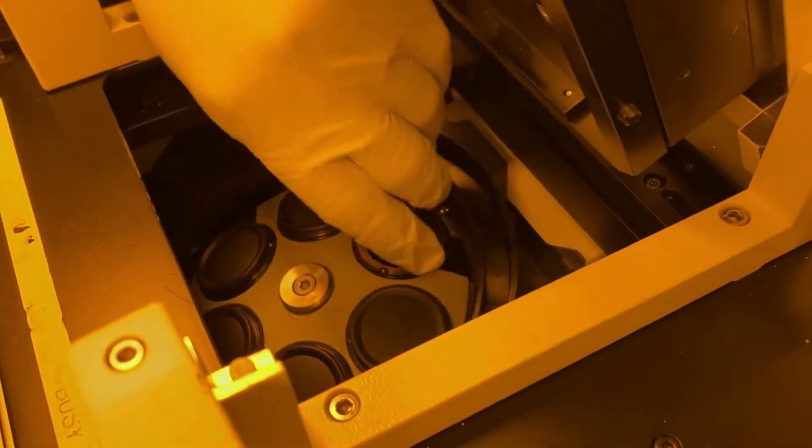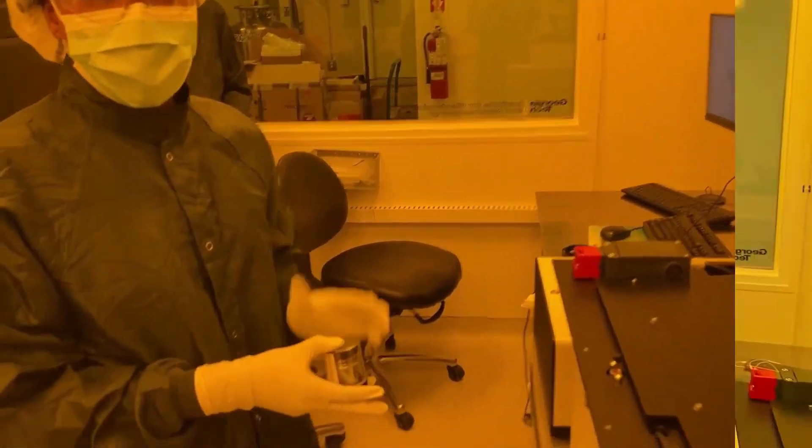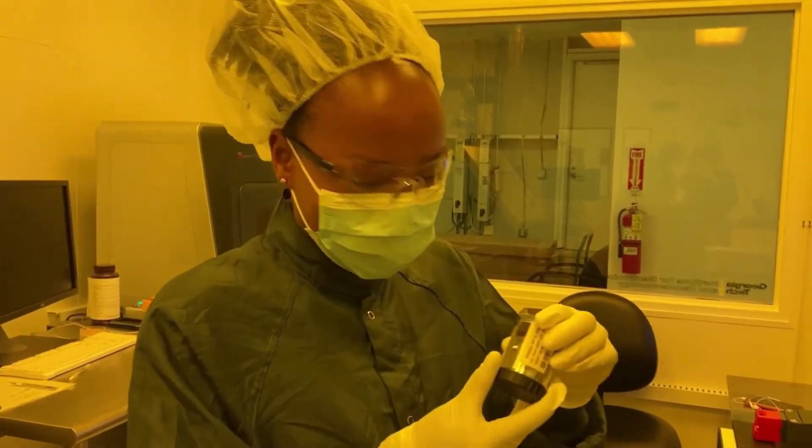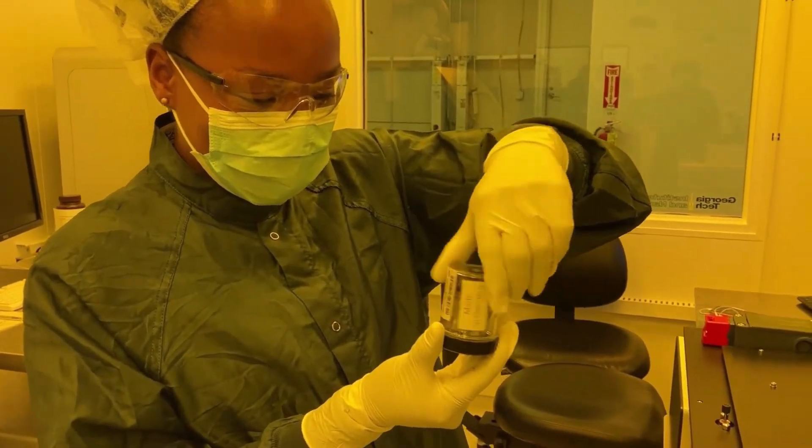Before you prepare your lens, make sure the top to the lens cap is off. Once you pick out the lens you need, carefully unscrew the top and take it out.